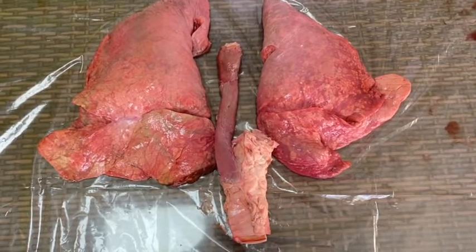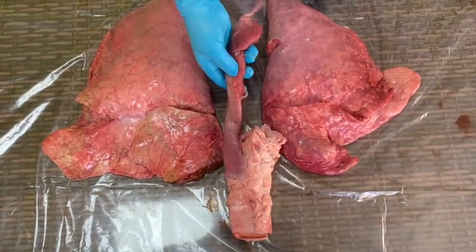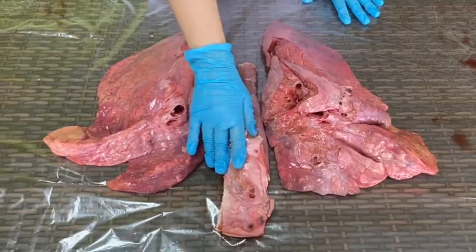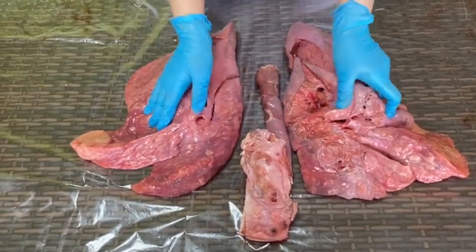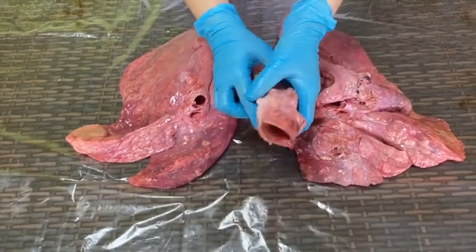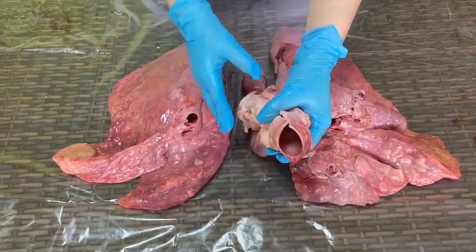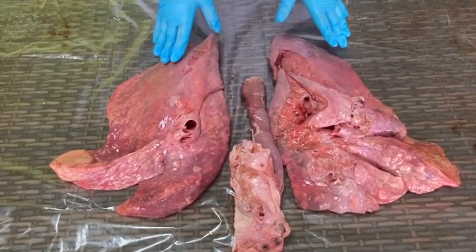These are some organs from the respiratory system that we are going to present. We have the trachea, the esophagus, and the lungs. The left lung is smaller to leave space for the heart. The trachea extends from the larynx and branches into the two primary bronchi. It is formed by horseshoe-shaped rings joined together vertically by overlying ligaments. The trachea serves as a passage for air, moistens and warms it while it passes into the lungs, and protects the respiratory surface from accumulation of foreign particles.